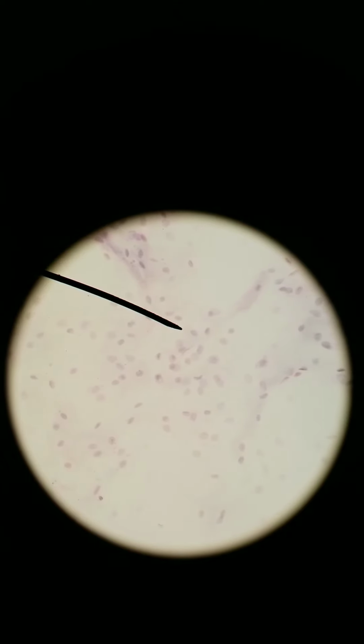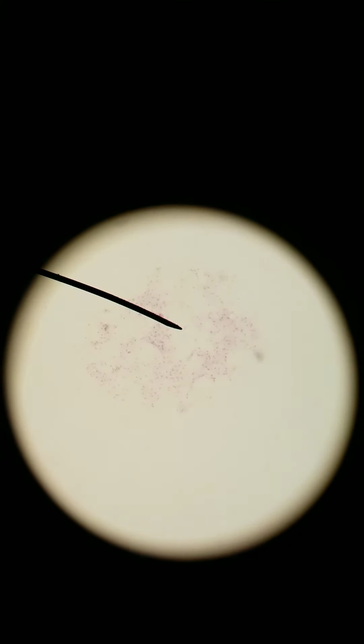I'm putting the arrow to the edge of the plasma membrane, and now I'm going to move the arrow to the nucleus. Whoops, too far. That's another nucleus, so that works too, I guess. But these are entire cells. All these that you see are dark nuclei and light-colored cytosol and plasma membrane. Because these look nice and flat already, nice and round, this is in a cross section. Back to low power, back to scanning.